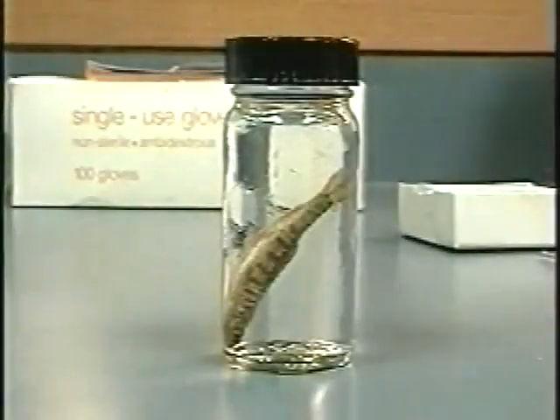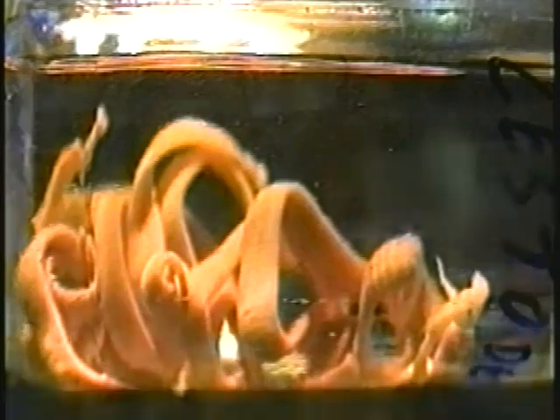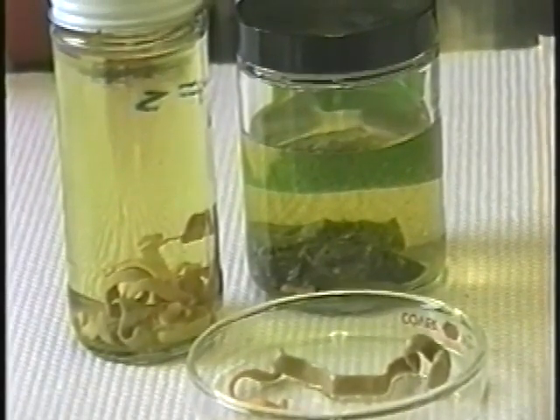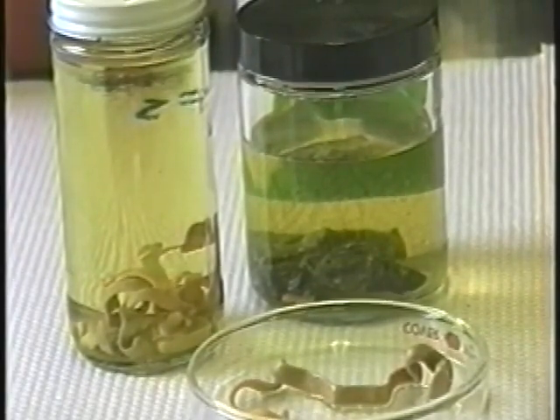If examination of fresh samples is not practical, it is generally sufficient to fix the sample or tissue in 5 to 10% neutral buffered formalin for 24 hours, then to transfer the samples to 70% ethanol for shipping or storage. However, for positive identification of certain parasites, it may be necessary to preserve fresh specimens according to a specific protocol. For example, identification of parasitic worms may require relaxation of the parasite in hot fixative or clearing for identification of hard parts. In these cases, it is best to consult a diagnostic laboratory for instructions.